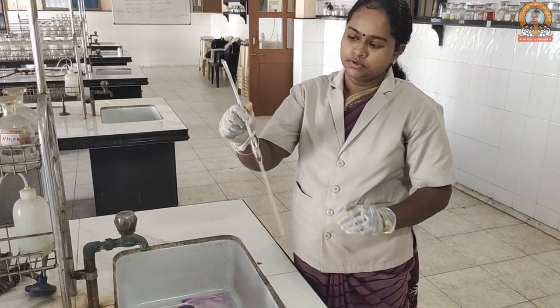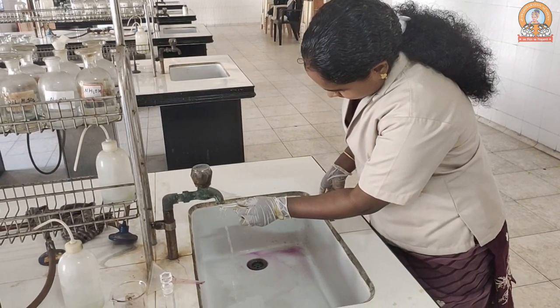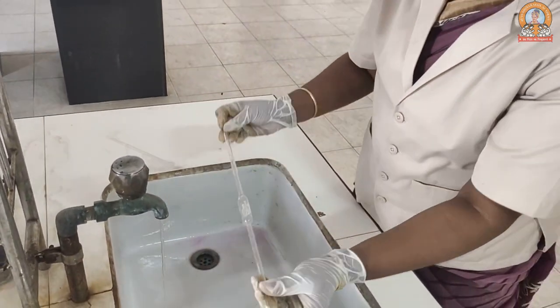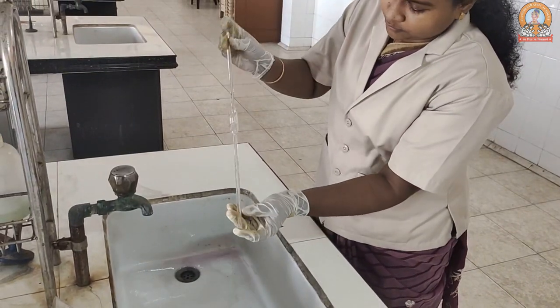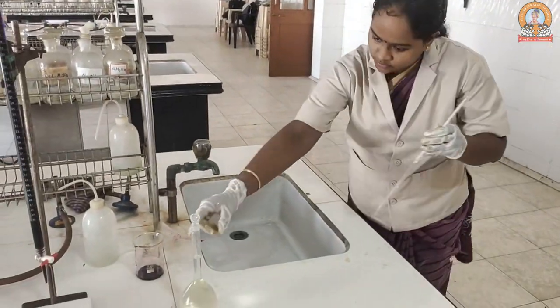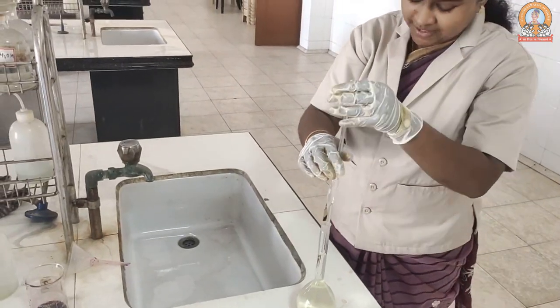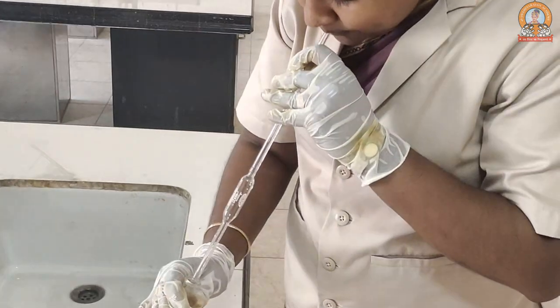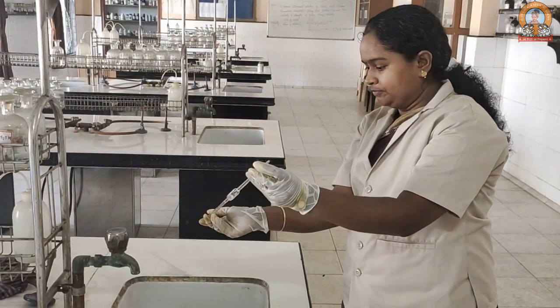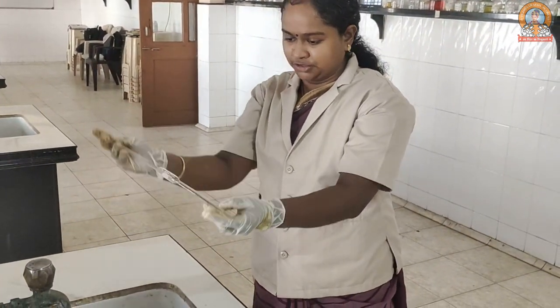We have a 10 mL pipette. We have to clean it the same way as we did with the burette — clean it with water first and then with the required solution. Fill the water first and clean it nicely so the whole of the bulb is touched. After washing, dip the pipette into the Mohr's salt solution, take a small amount, and tilt it the same manner so the water molecules are removed with the standard solution. Repeat the washing two to three times.